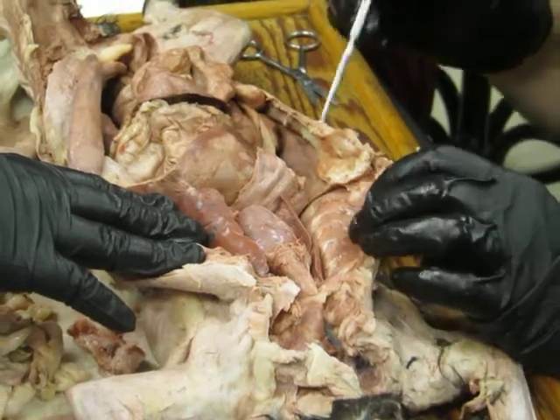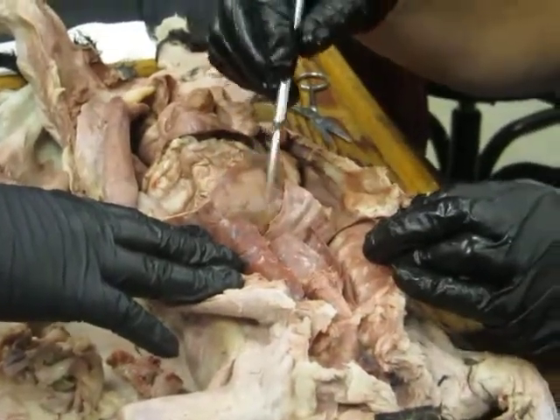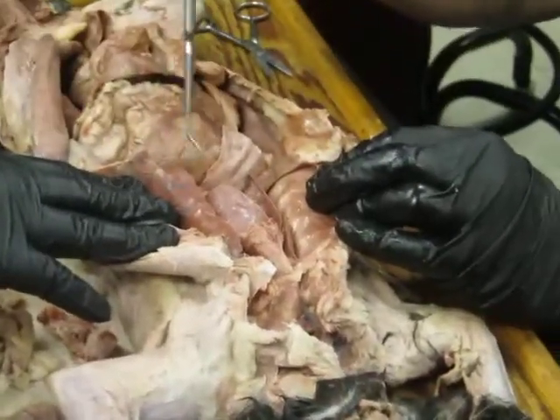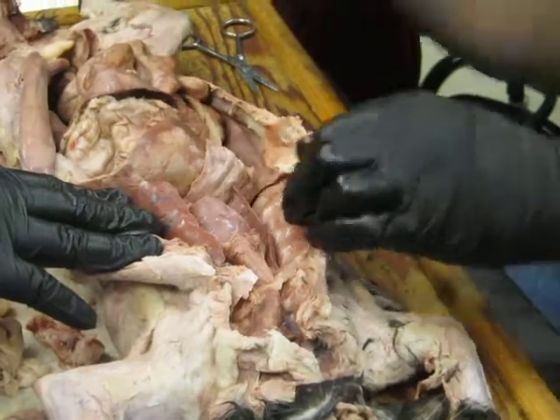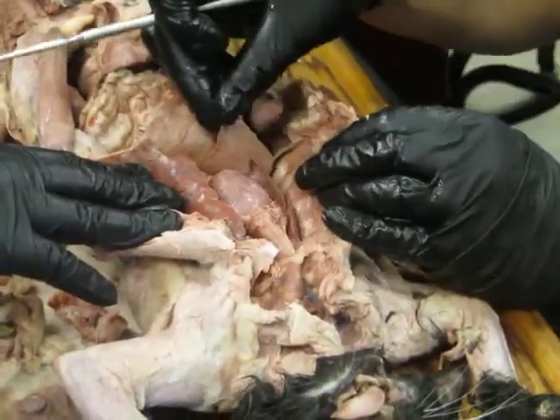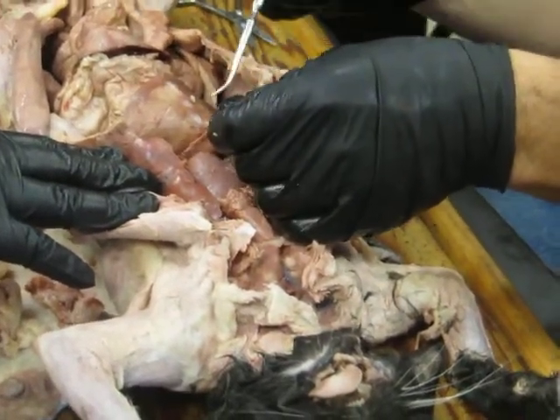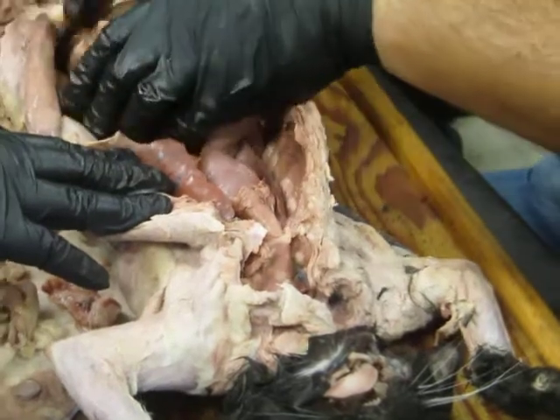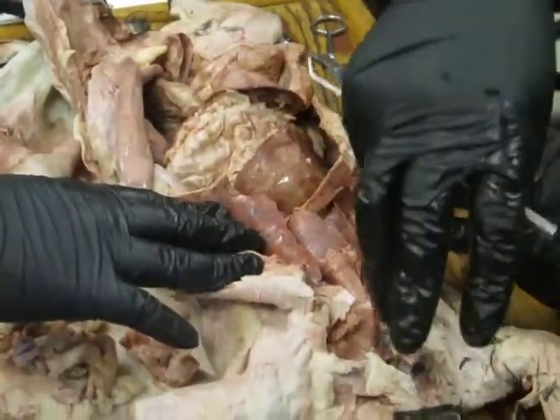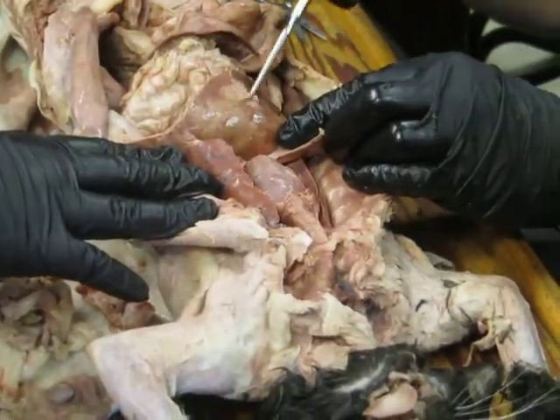Okay, just say it. It's good to hear yourself say it. That muscle memory. Okay, so that's the pericardial cavity, pleural cavities, and generally that whole area is the thoracic cavity. And that's separated from the peritoneal cavity by this partition. Remembering this is the diaphragm, exactly. And so we'll come down and we'll look at the abdominal organs and then come back up to look at the head and neck. So this is liver.